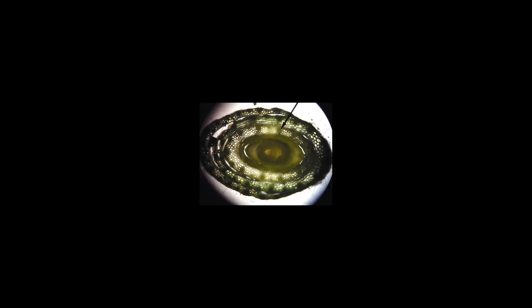So be very careful. Enjoy the experience. I want you to see cross sections, longitudinal sections. I want you to look at the roots and see the fascinating parts of the root. And I want you to see those plant lips, those stomata. Amazing structures that allow the gases to go in and out of plants. All right. Thanks for joining y'all.